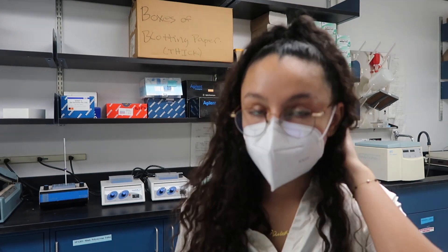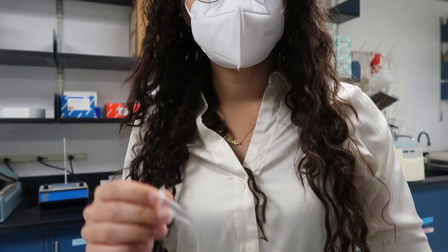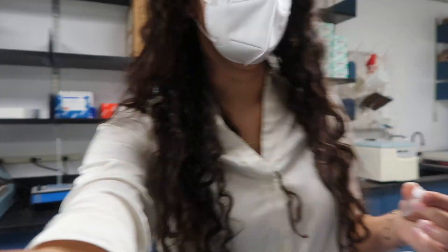Okay so I just did my last wash and next we will do secondary antibody incubation. I finished the last wash, I optimized the conditions to place the secondary antibody — which is just a fancy way of saying I kind of dried everything that needs to be dry. And now I'm about to place the secondary antibody. Actually, I like to centrifuge this down first, so let's do that.